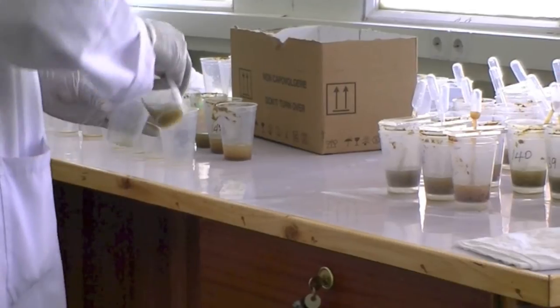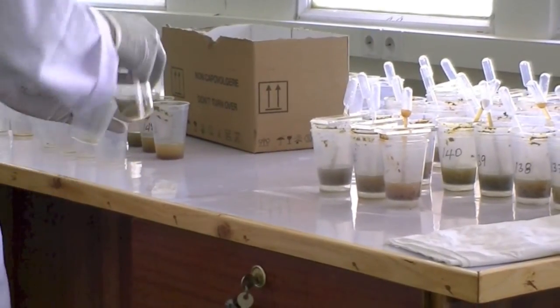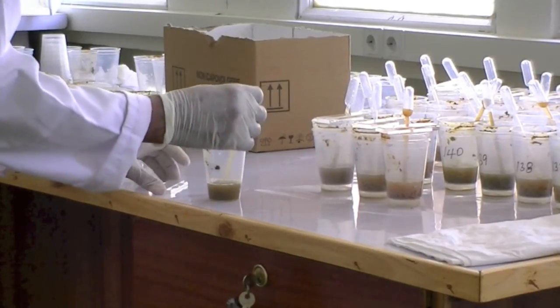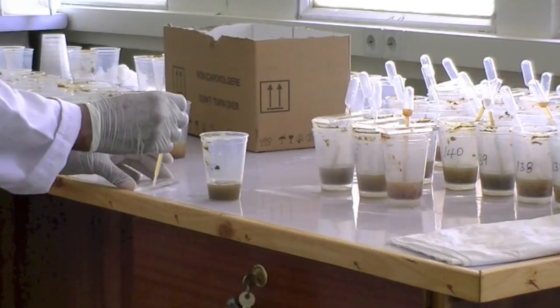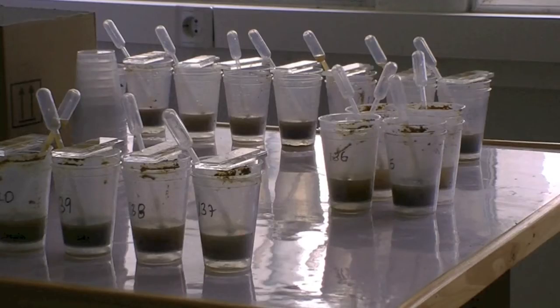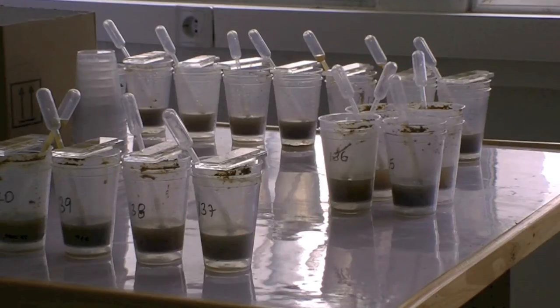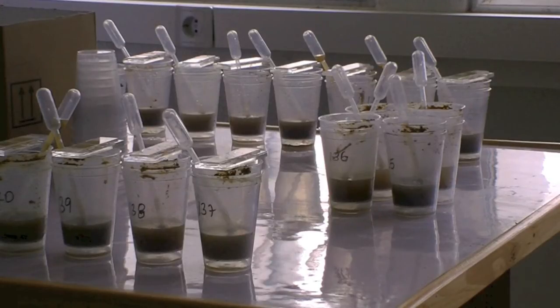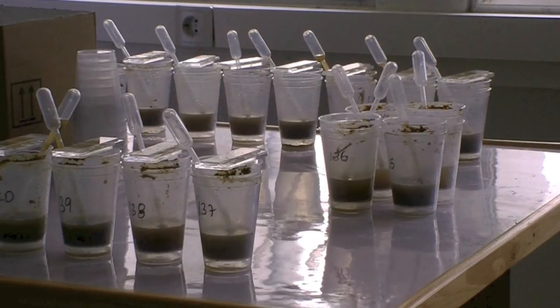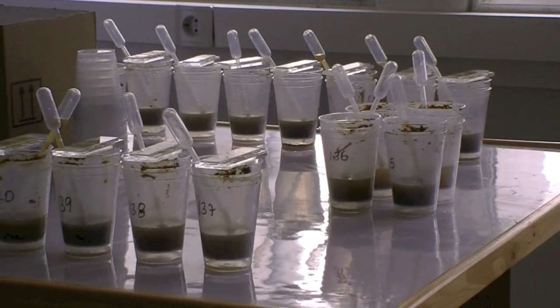In the final step at this table, the McMaster slides are filled. To optimize the workspace available and to decrease possible errors, the two beakers used to process the sample are put one in the other with the McMaster slide on top. The pipette that was used to transfer the suspension is put aside in the beakers. Notice that all samples are still lined up according to their number. The lowest number is placed most closely to the edge of the table and should be processed first.